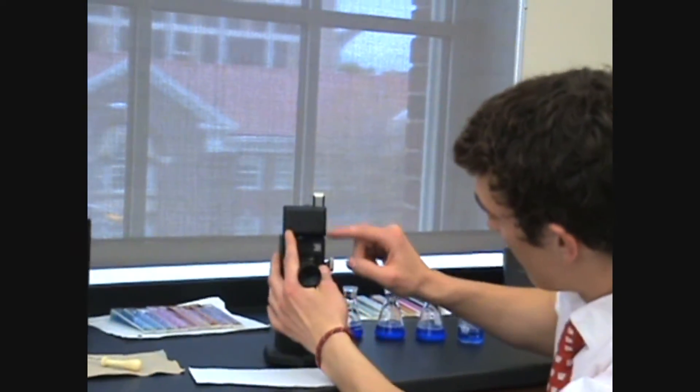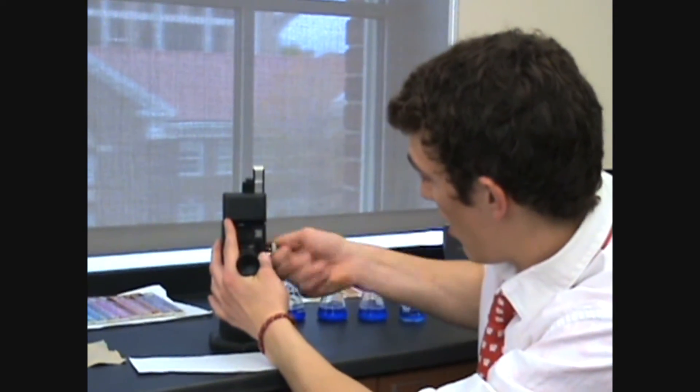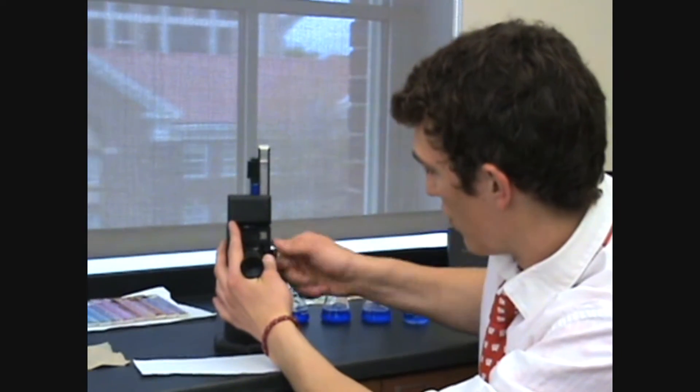And then, you take the reading that you have here, which ranges from 0 all the way up to 100.